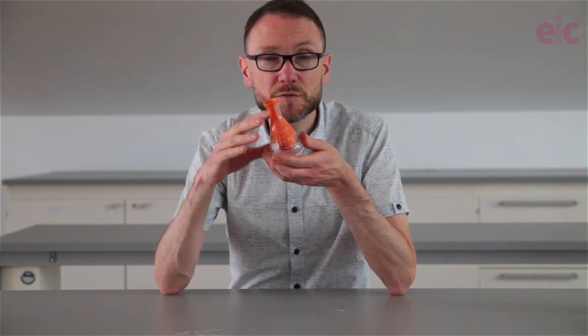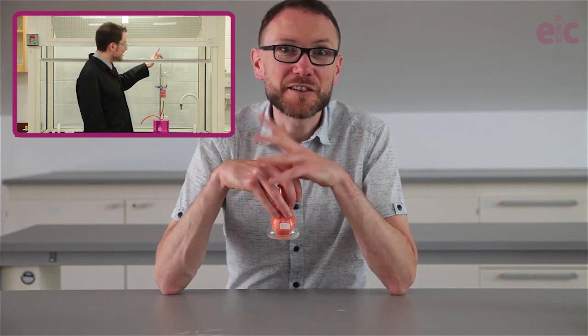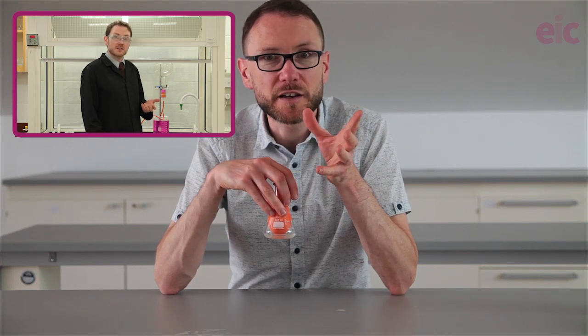Because of the rapid pressure changes we're going to be achieving here, we will need to be using some borosilicate flasks, and of course we'll be loading them with ammonia. Now the last time we spoke about fountain effects was just over 10 years ago, and this chap with a slightly stronger London accent and significantly more hair than me guided us through the process of collecting ammonia gas in a dried flask. But CLEAPSS have updated a couple of details since then, so let's revisit.